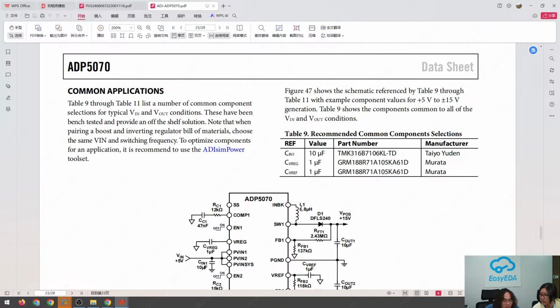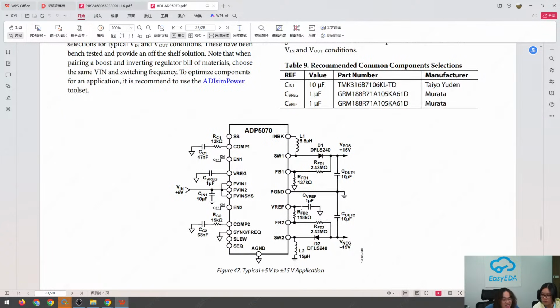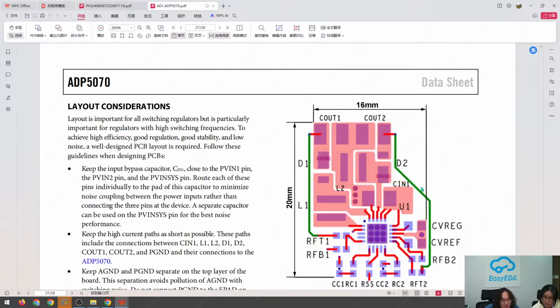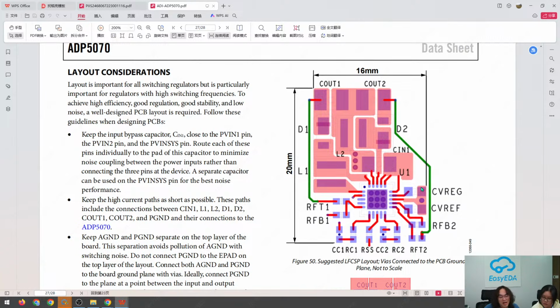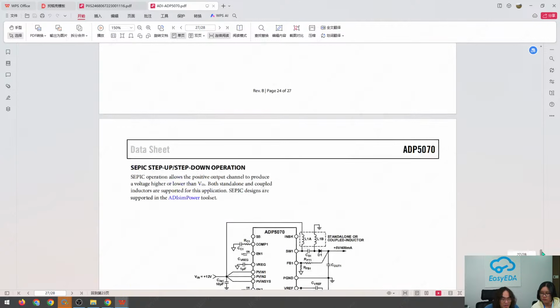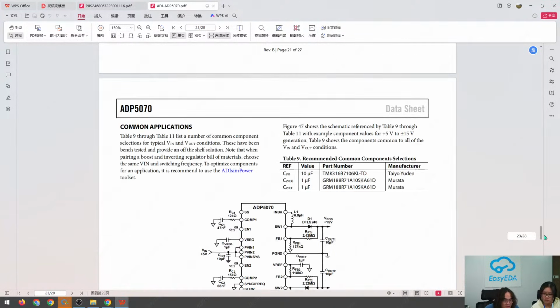So although they indicate the same net label, when you lay out your PCB, you have to isolate them. If you don't want to design the PCB layout and don't want to care too much about them, you can just follow this layout here, and you can achieve a good performance. So let's continue.